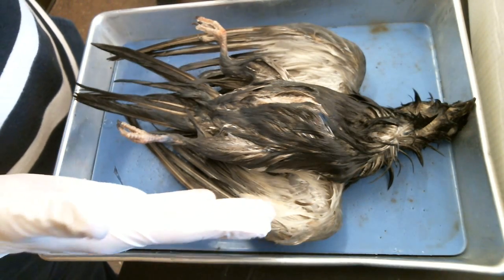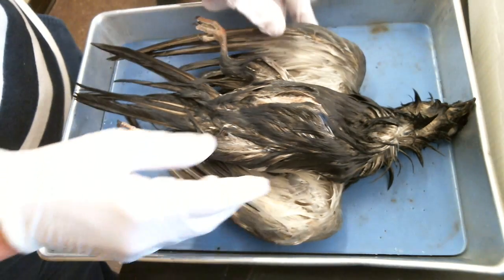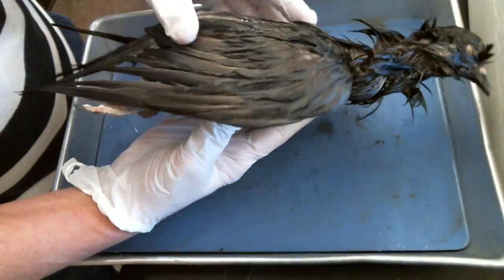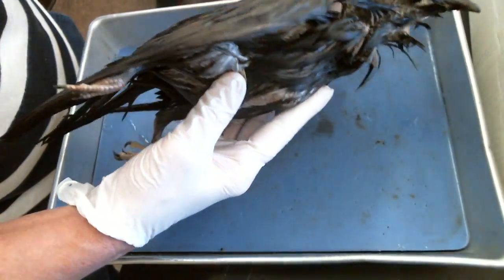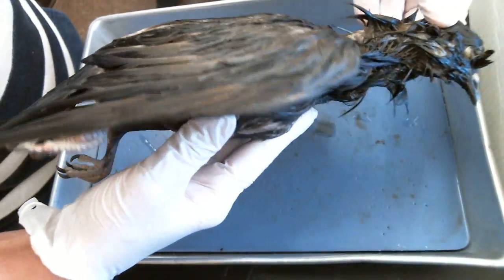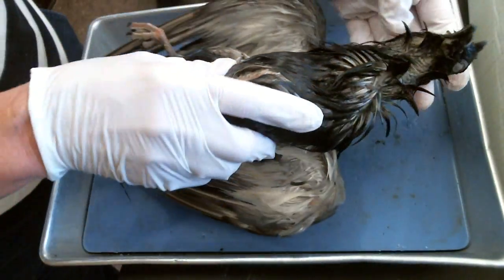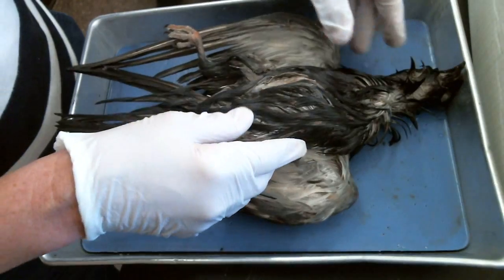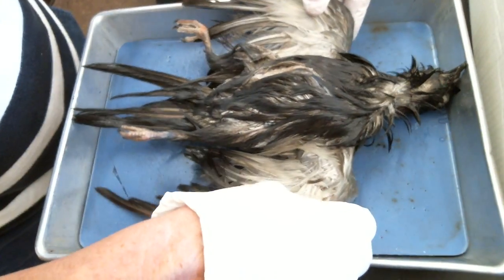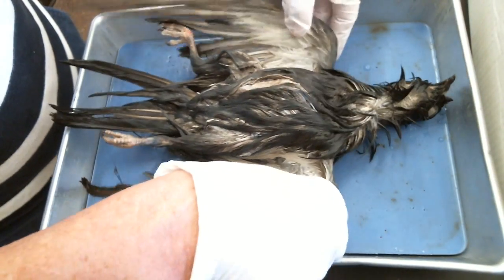We're going to dissect the pigeon today. The first thing you'll do is just look at your pigeon. The obvious thing, of course, is the feathers because that's what makes it a bird. If you don't have feathers, you're not a bird. If you have feathers, you are a bird.